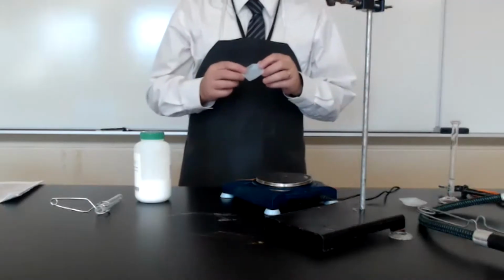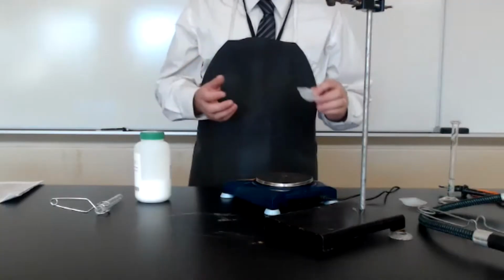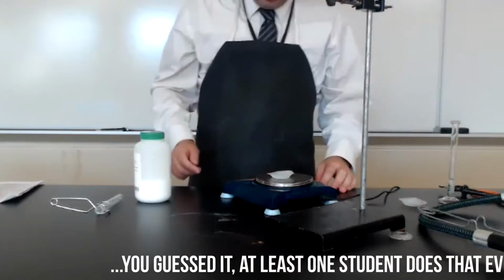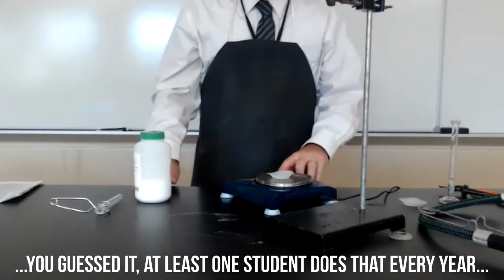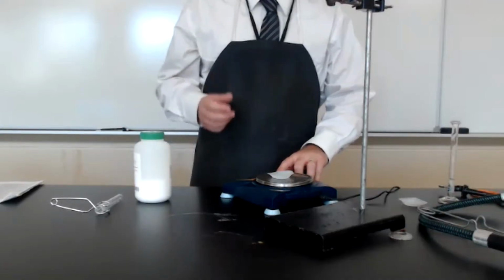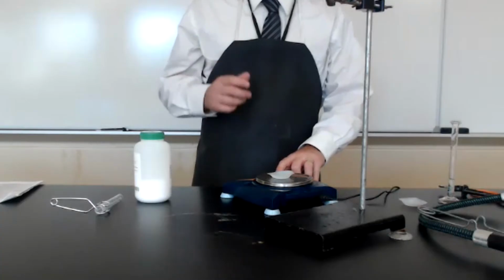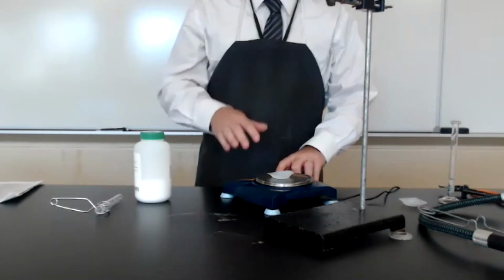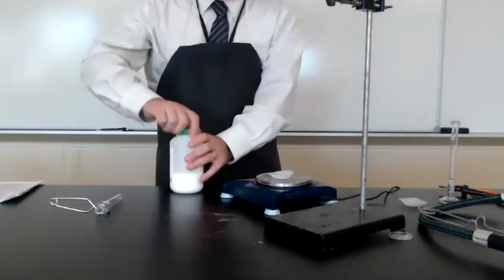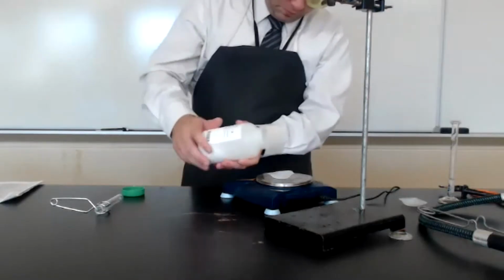A weigh boat is a simple way of holding a substance for weighing before using it. We don't want to pour the substance directly onto the balance. So we're going to place our weigh boat on the balance, and we're going to hit the button on the left side of the balance that says 0, or sometimes it says tare, T-A-R-E. What that does is it sets the balance back to 0 and subtracts out the mass of the weigh boat. Now we're ready to add our 0.5 grams.